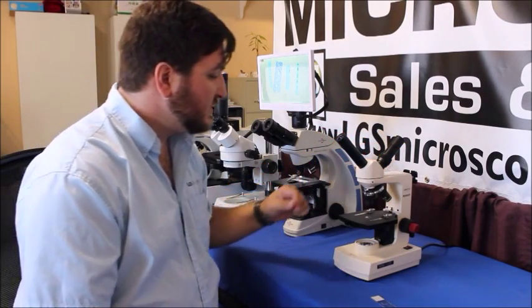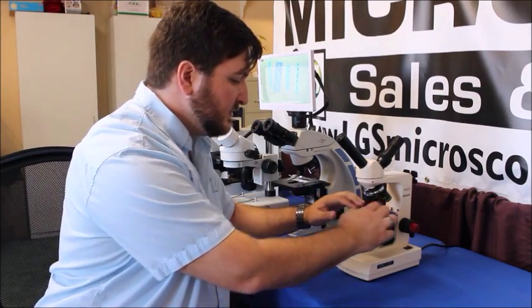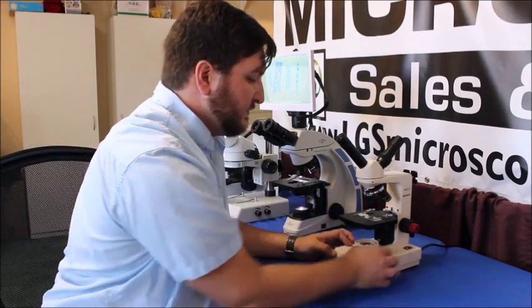So what we're going to do is go through our setup the same way as we did before. You can always look at our Microscopy 101 video to reference that.